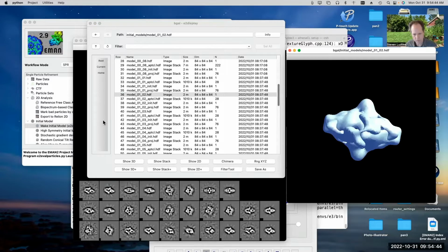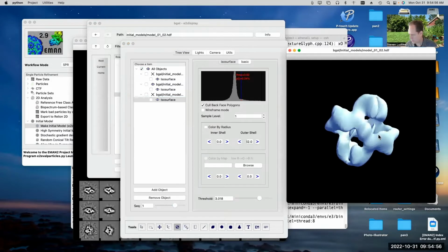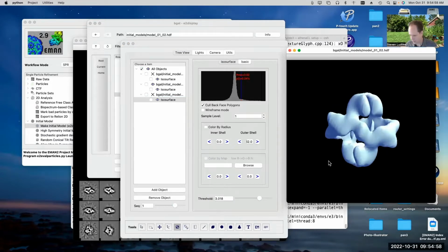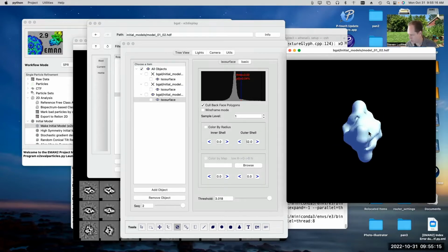So let's, oops, I lost my control panel. Where did it go? Oh, there it is. Okay, so this is the one I don't like, and this is the one that I do like. You can see it's a lot narrower. It almost looked like a 4-fold symmetry in the other one. And this one is sort of shorter in this direction. But that means it also has a projection which is sort of more elliptical.